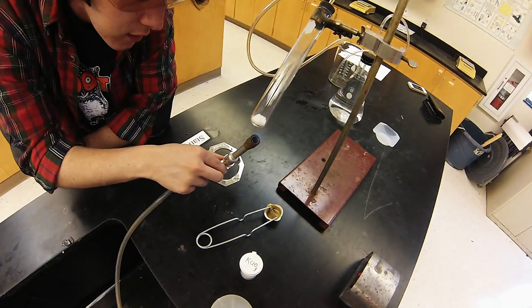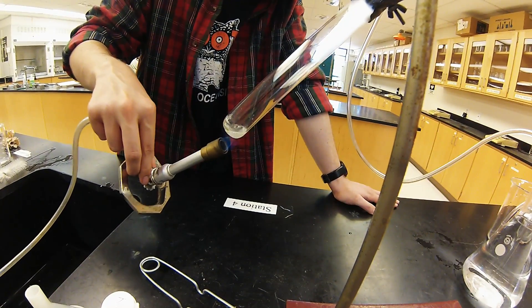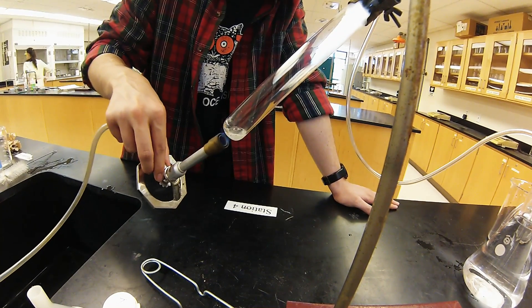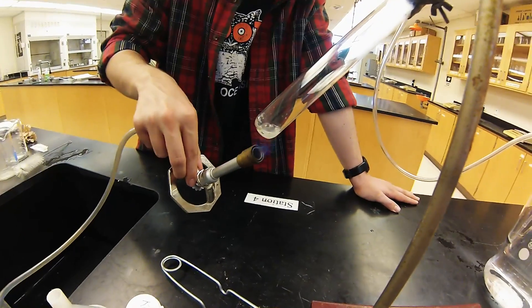And it's going to start to slowly melt. Notice how Dylan holds the Bunsen burner, making sure not to burn my hands or change the flow of oxygen or gas.